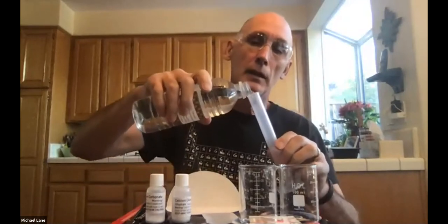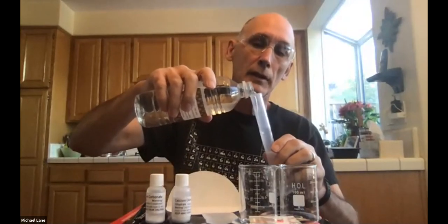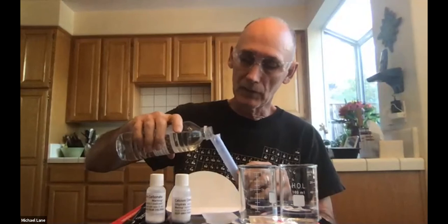But if not, none of the changes that I might make, ever so slight, really have any bearing on how things work out. So one of the first things that's asked for is to get 25 milliliters of water. The volume is not critical, right? It is only there to get everything dissolved. So if it's 24 or 26 or 23 or 27, it really does not make any difference at all, right? So one of the keys to being successful in the laboratory is knowing when to pay real close attention to something and when something really just is not that important.